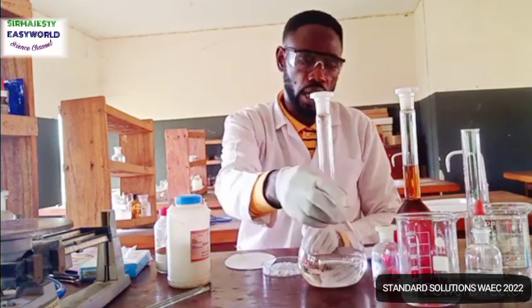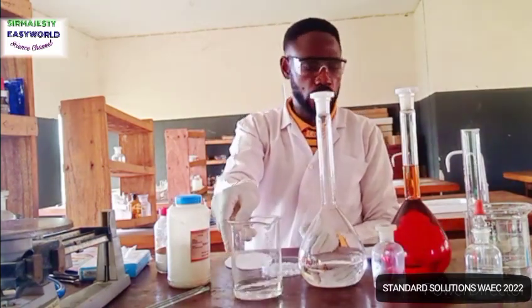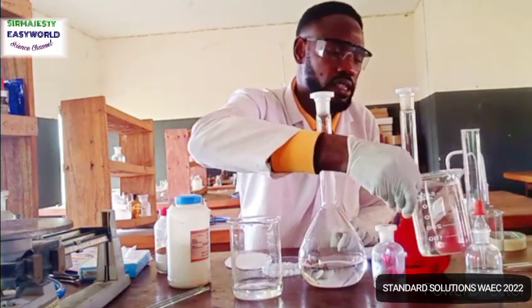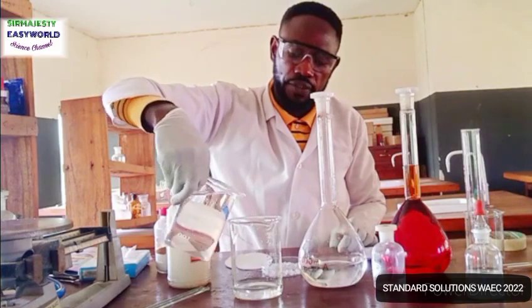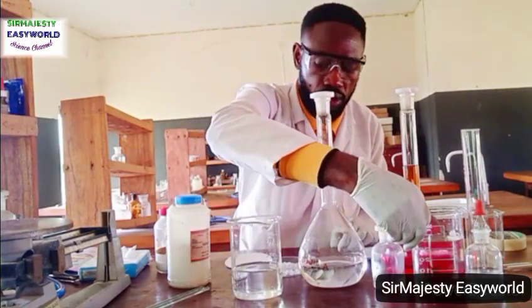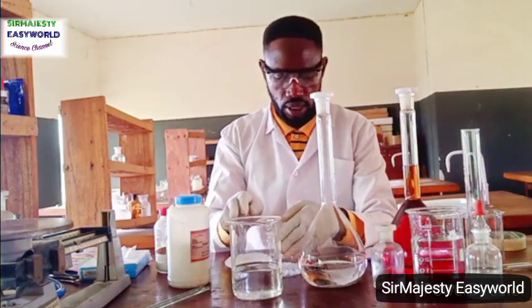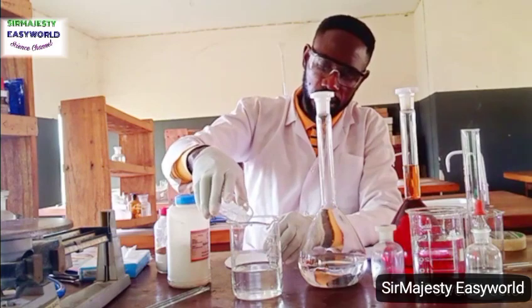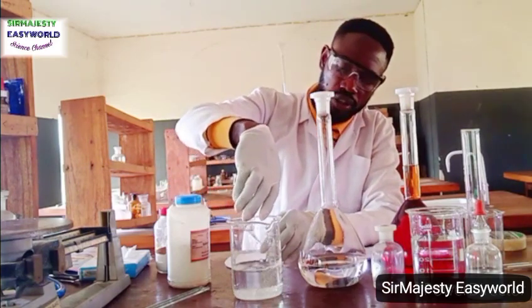You can also dissolve it in a small amount of water like this. Remember, don't dissolve to such an amount that will exceed, let's say, 500 in the beginning, so that it can make up very well. So using your discretion, when you look at this volume here and this volume here, they cannot reach this place. So what I do is, I will add this to this for the crystals.